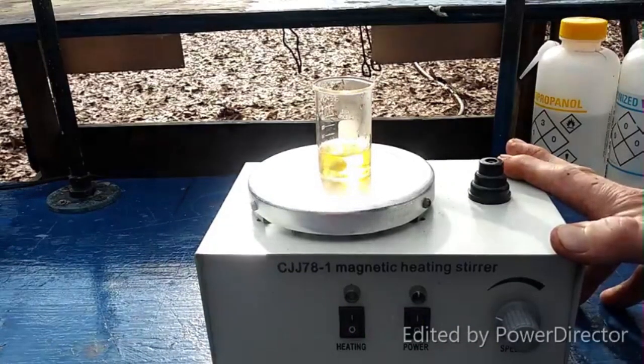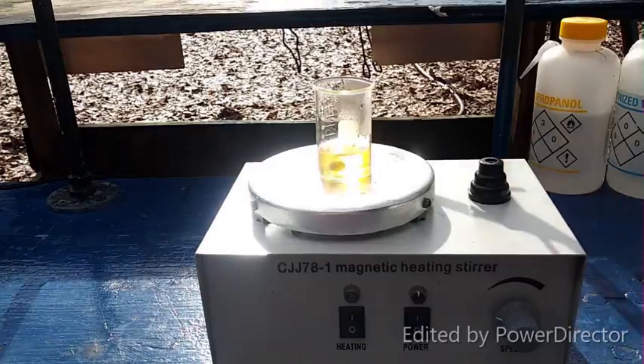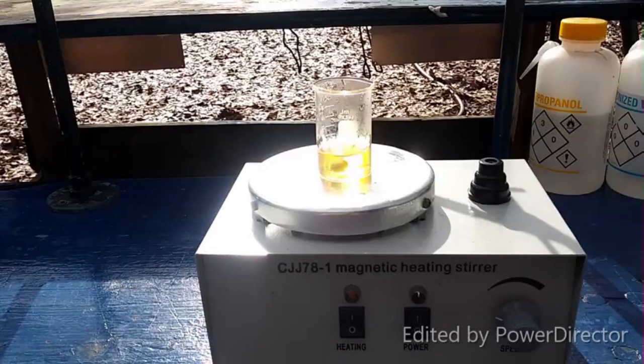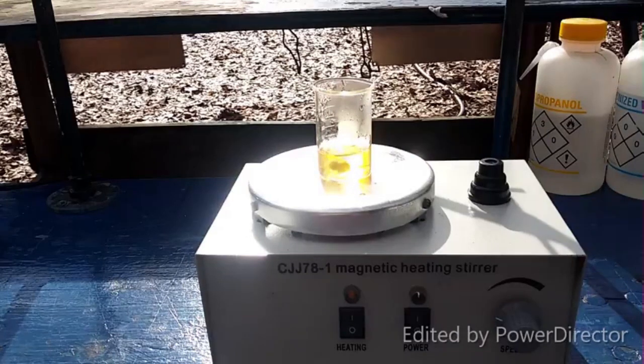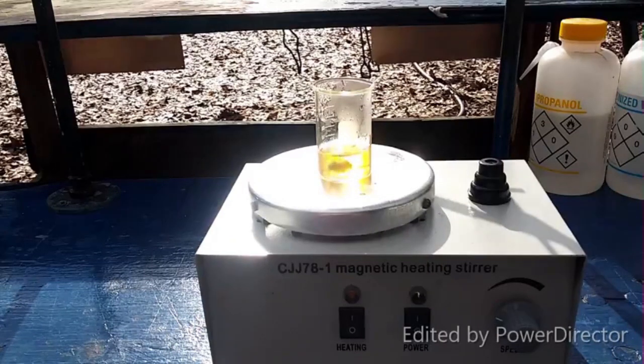We can see it's already off color, but I think that's from bromine, because when I tried neutralizing thorium hydroxide directly with hydrobromic acid, even though it was azeotropic hydrobromic acid and was crystal clear, it immediately reduced some of the bromide down to bromine. Once I diluted it down, I didn't really have too much of a problem with that. But I think that's what that might be.